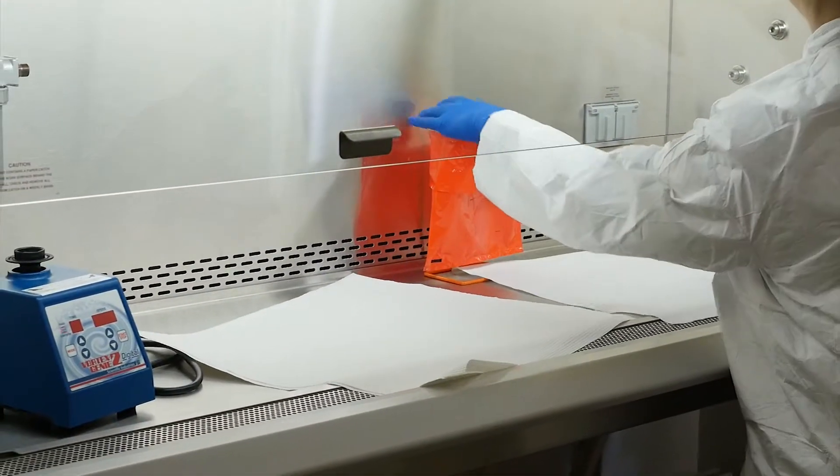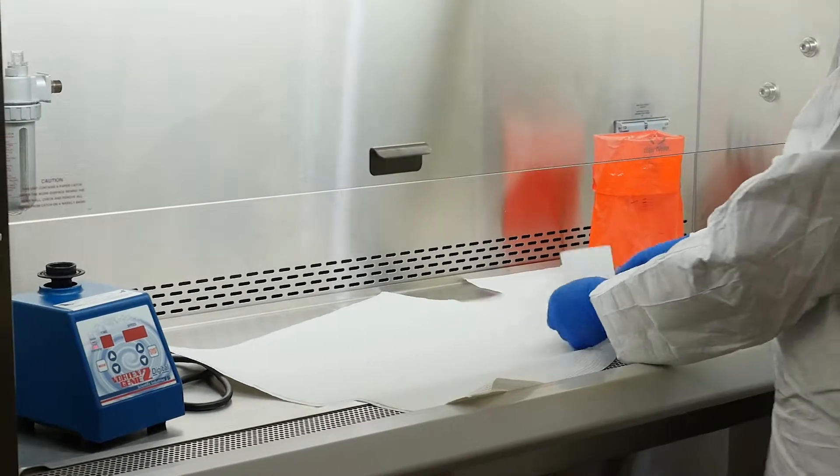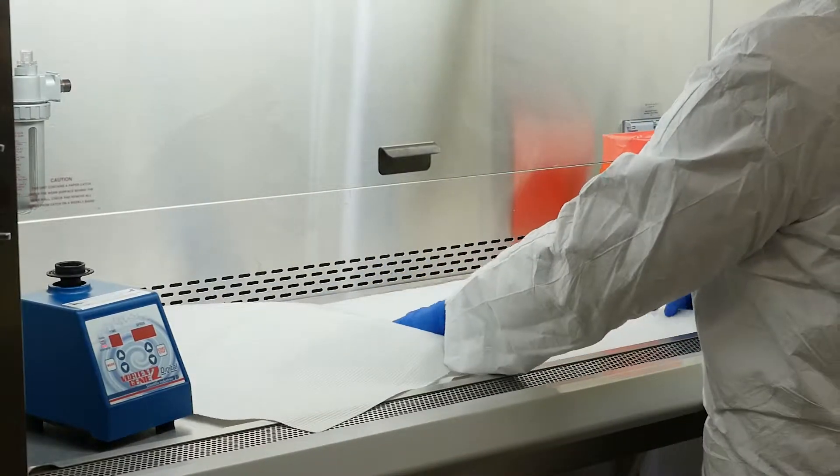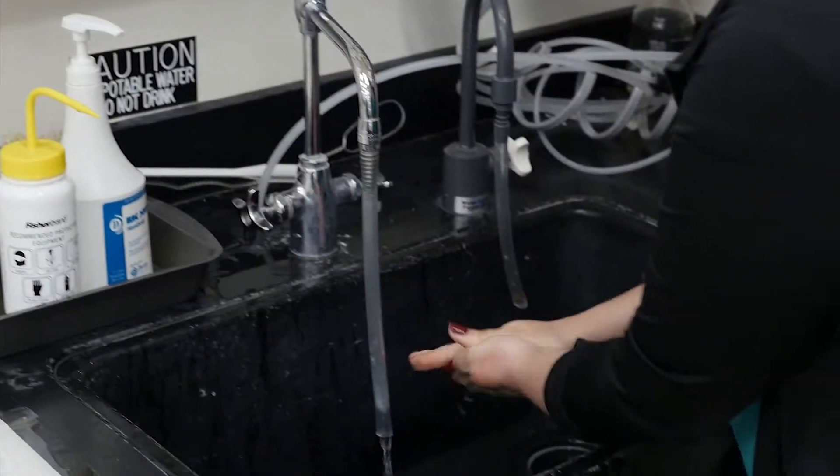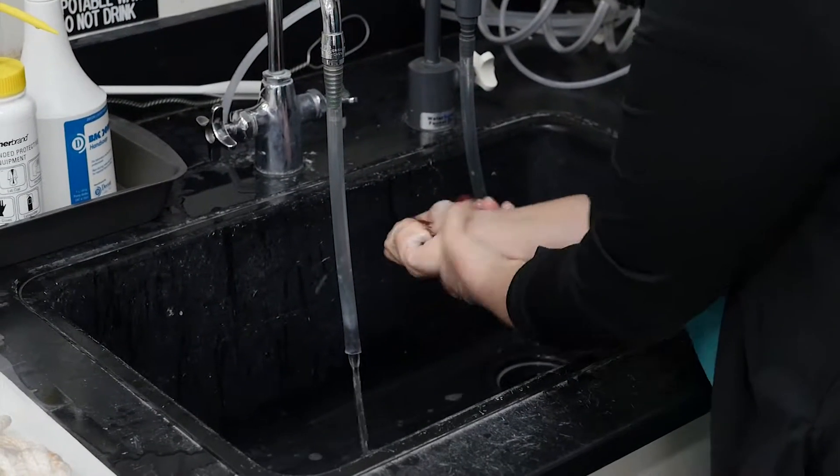To protect your own safety and your sample's integrity, all work should be conducted in a certified Class II biosafety cabinet. You should wash your hands with soap and water whenever de-robing or leaving the laboratory.